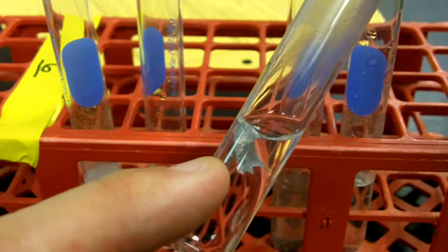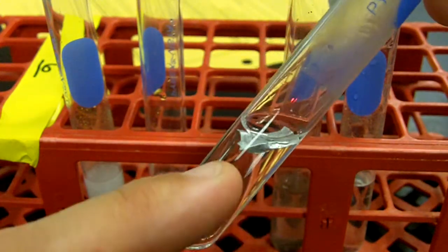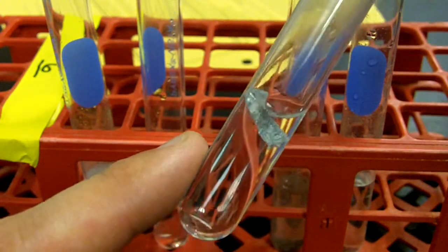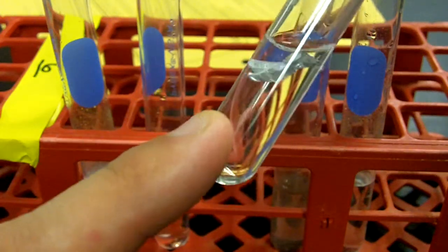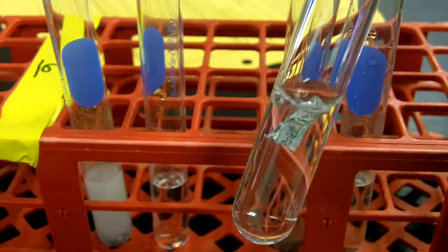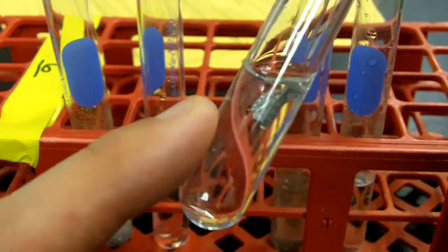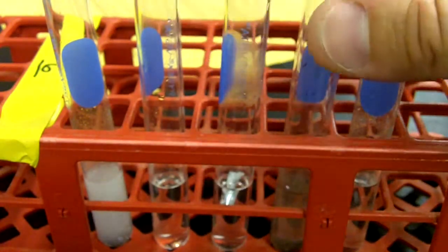Hard to make them out, but they're definitely there. So the aluminum, although slow, is reacting. No appreciable heat coming off the aluminum. Still feels like it's at room temperature. Shaking it off completely, still floating a little bit. Just microscopic little bubbles clinging to that surface.